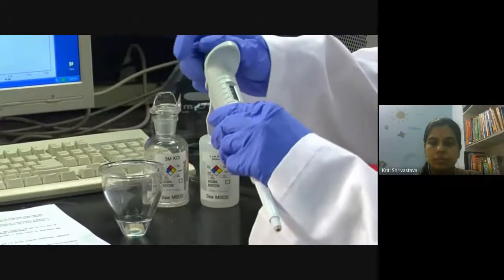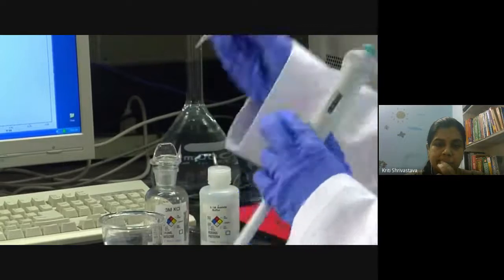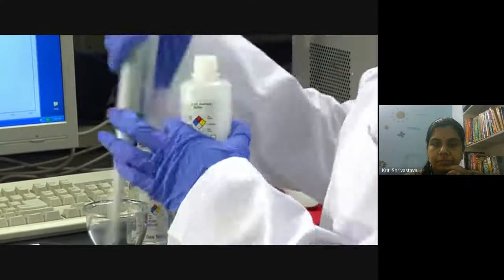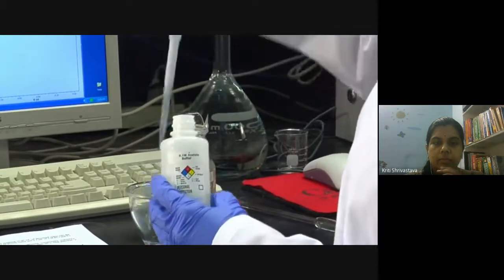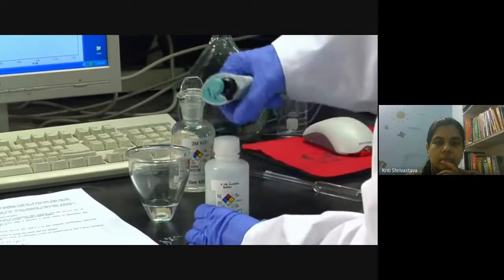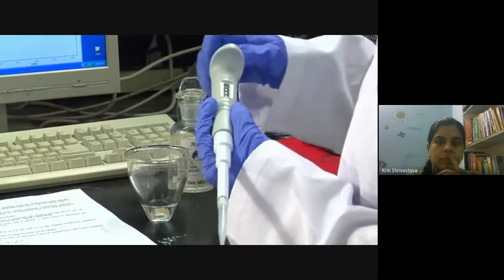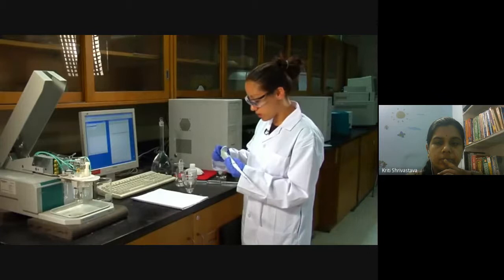Add an acetate buffer — about 0.5 mL — using a micropipette which makes measuring small volumes much more accurate and easier. Take a fresh tip. This is the only time you can pipette directly from the stock, because the tips are very sterile and clean, so you don't worry about contaminating the stock solution. Then add 0.1 mL (100 microliters) of concentrated potassium chloride to help with the redox reaction.